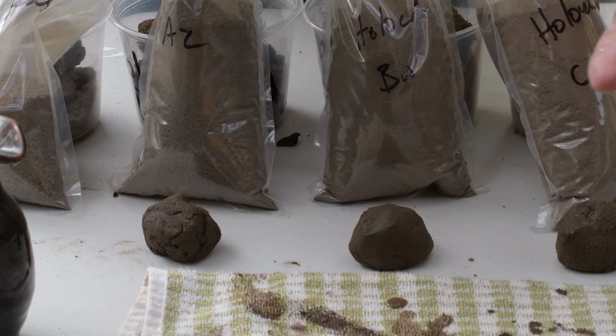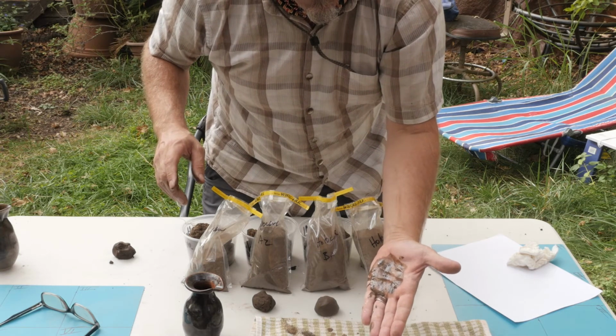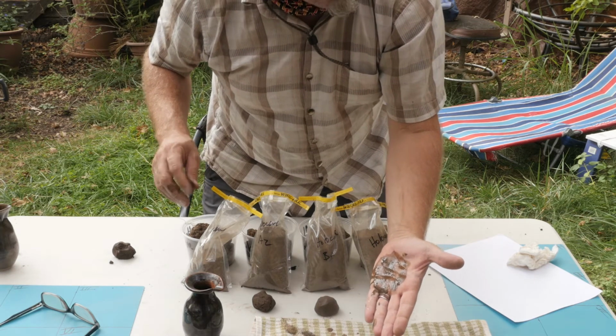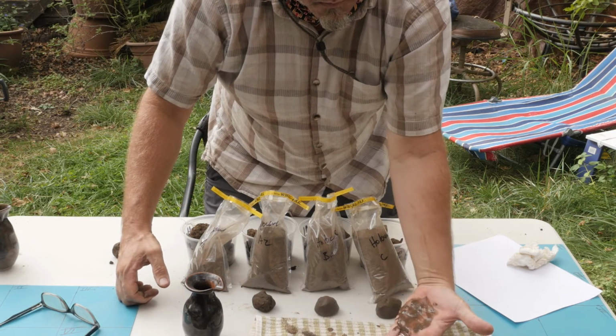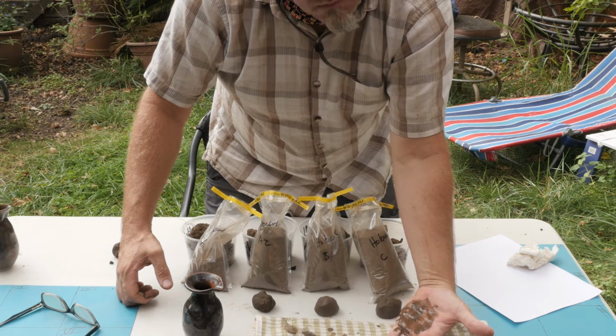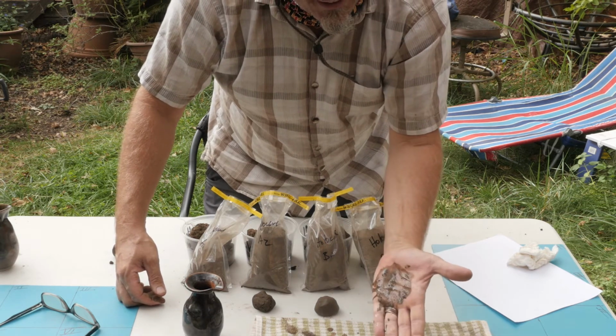Is that one of the breakouts in there? Yeah, so, does the soil feel very gritty? I would say no. If no, then the next question is, does the soil feel very smooth? No, it's in between. Okay. Is that a classification? Yes. Good. It is. Fantastic.